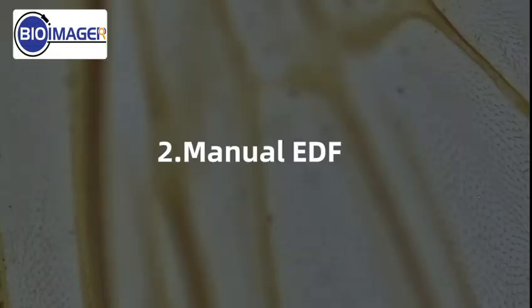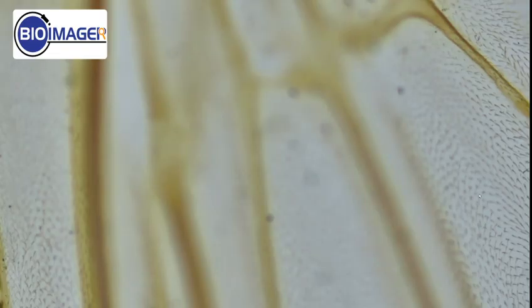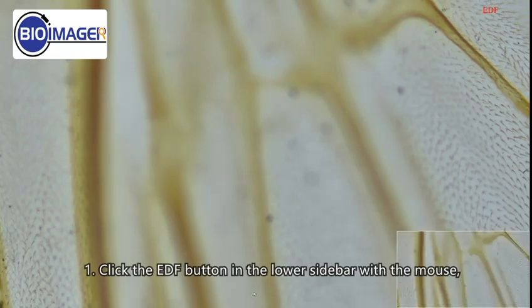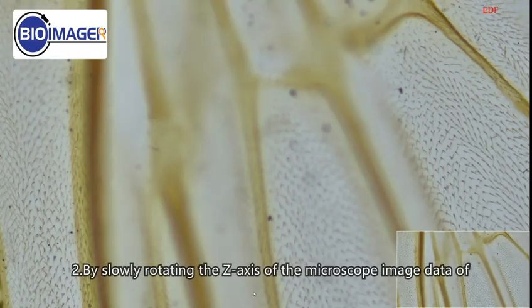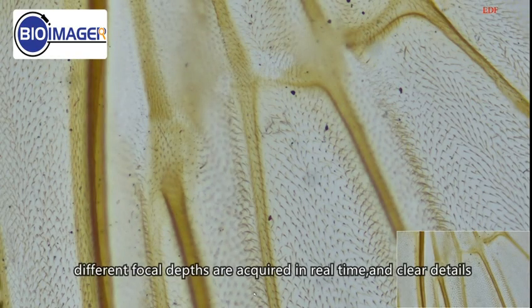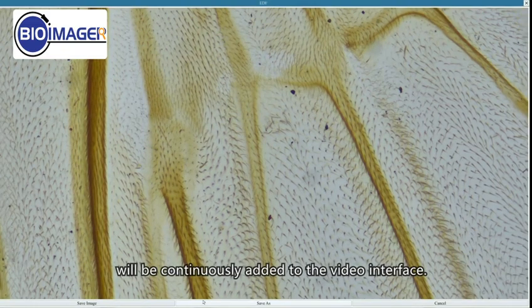Manual EDF. Manual EDF operation steps. Click the EDF button in the lower sidebar with the mouse. The window in the lower right corner displays the real-time video, and the preview window displays the image after EDF in real time. By slowly rotating the Z-axis of the microscope, image data of different focal depths are acquired in real time, and clear details will be continuously added to the video interface.